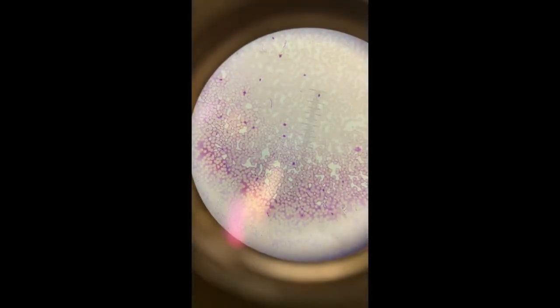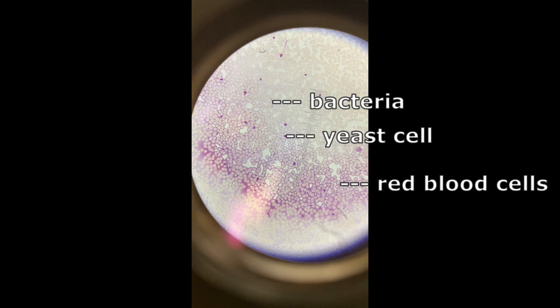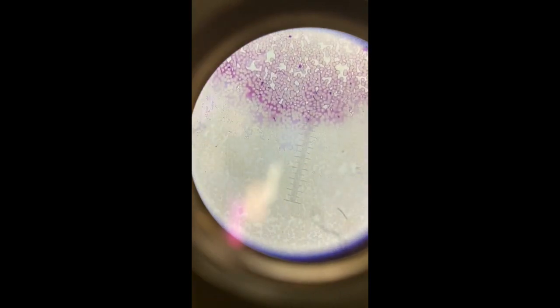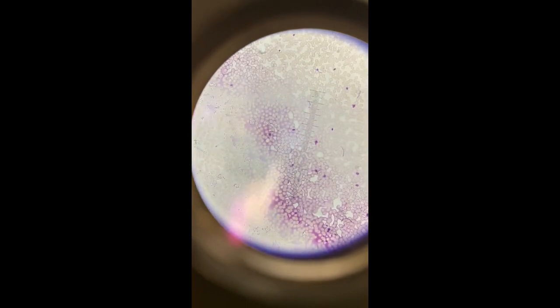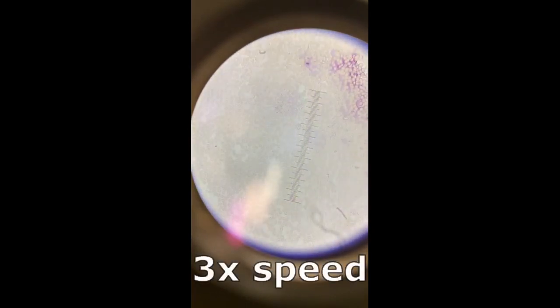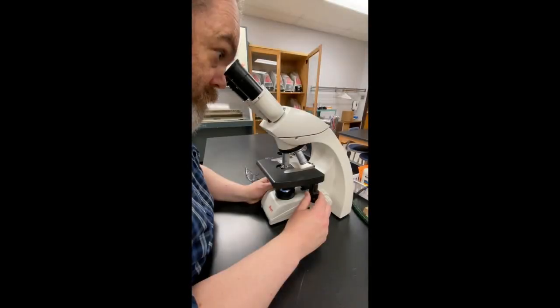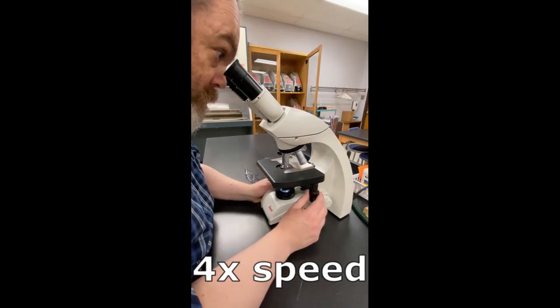Using the high power lens, we start to see some of the details of the sample. This sample is blood, yeast, and bacteria. Look around the slide and find an area of the sample that you want to zoom in on. Once we move to the oil immersion lens, the chance to look around becomes limited. Time spent now to get things right will pay off when we move to the oil immersion lens.